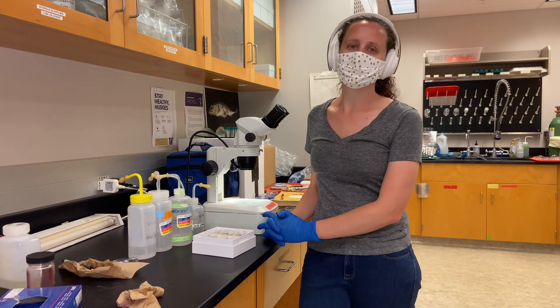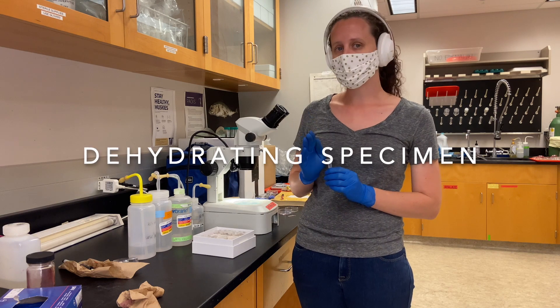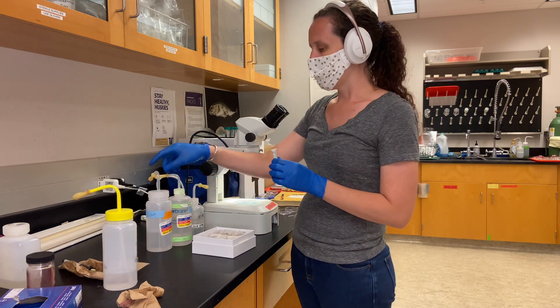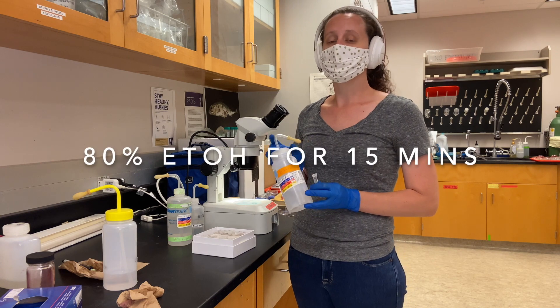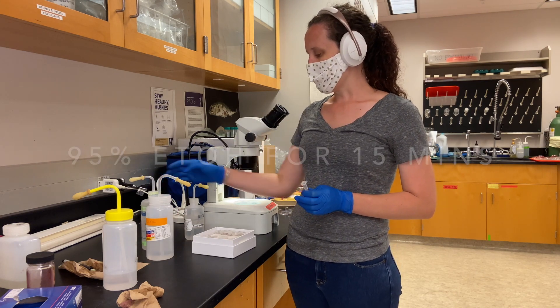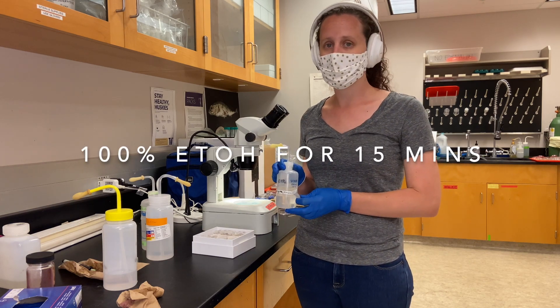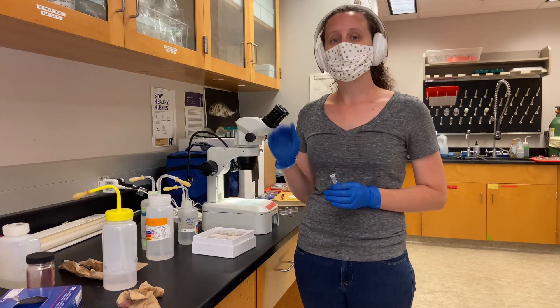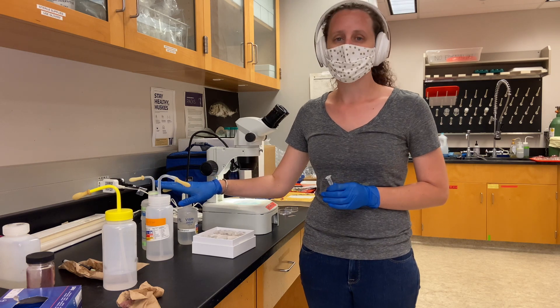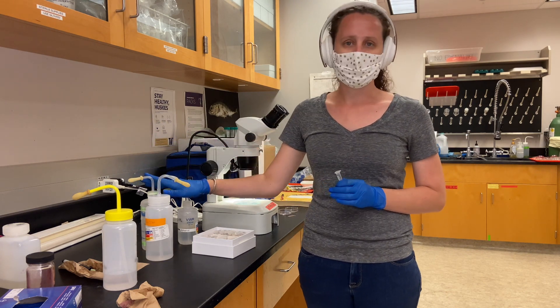After the specimens have been taken out of the sodium bicarbonate and acid alcohol solutions and are back in their tubes of 70% ethanol, we're going to do the dehydration steps where we take them from 70% ethanol to 100% ethanol. We'll move them into 80% — they'll stay in 80% for 15 minutes at least. After that, they'll go into 95% ethanol for 15 minutes. Then they'll go into two steps of 100% ethanol — 100% for 15 minutes, and then a second 100% ethanol for 15 minutes. A good place to stop if you need a break is 70% or 80%. Once they start going into 95% and 100%, you want to start mounting them that same day.